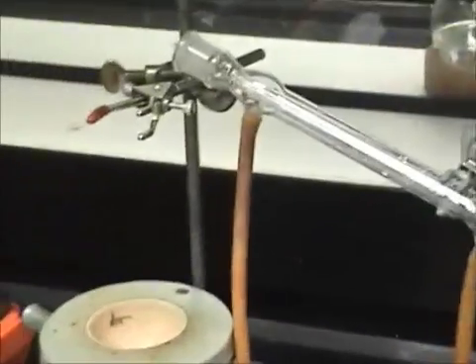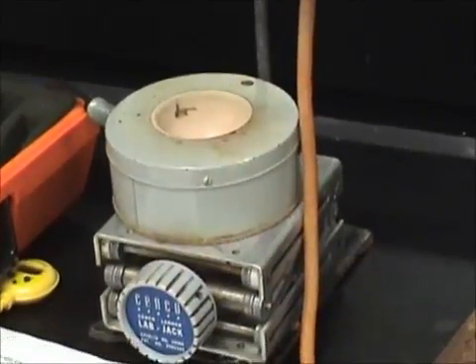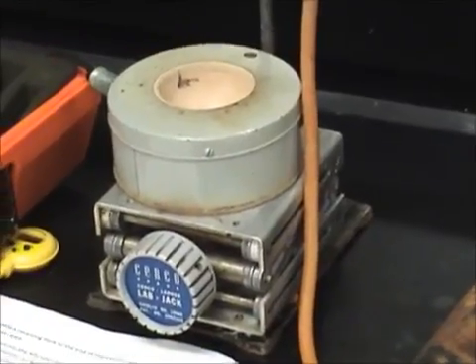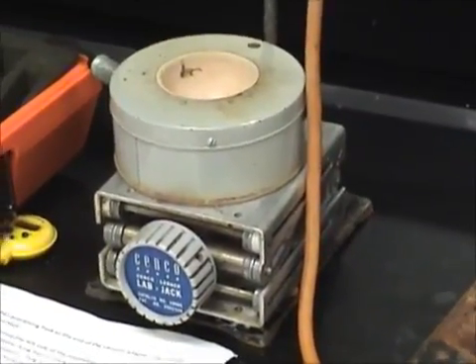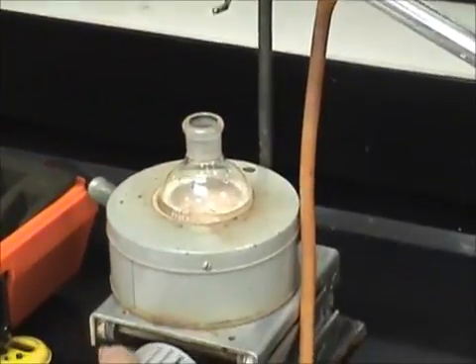Now let's set up the left side of the distillation. Make sure you have a jack stand and a flask heater lying flat on the ground. This is the heating mechanism for our distillation. Plug it in, but do not turn on the power yet. Place the distilling flask into the flask heater. Raise it to the proper level.